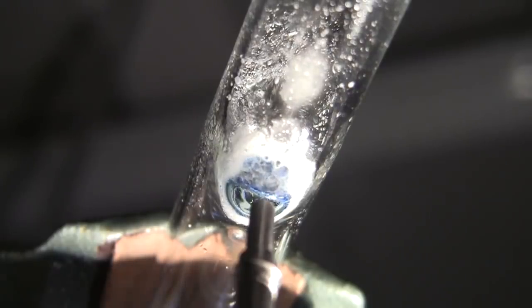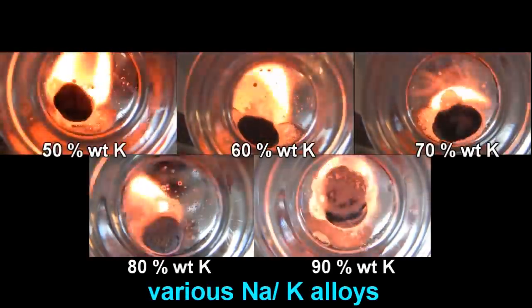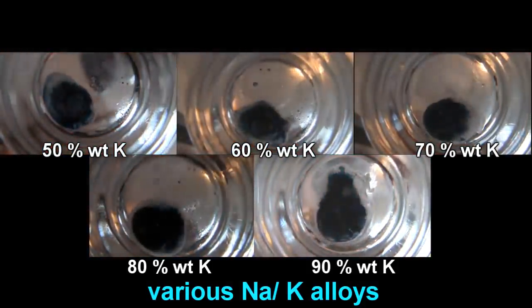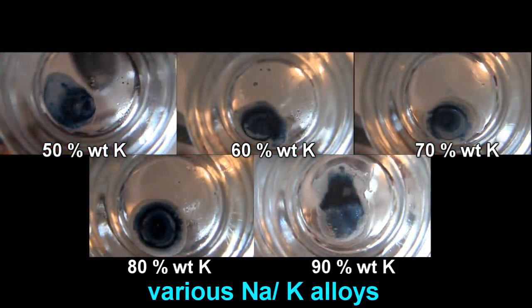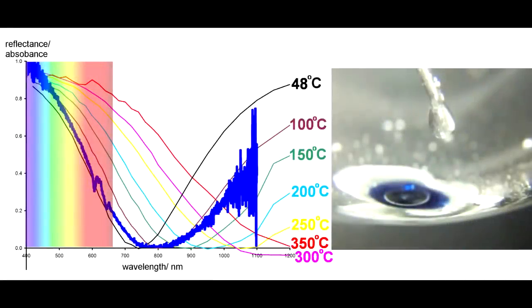Indeed, it's quite easy to measure the spectrum of, and you don't even need an argon atmosphere for it. It's quite fantastic. It's fantastically blue, though. The spectrum bears a convincing resemblance to the spectrum of the solvated electron in water.